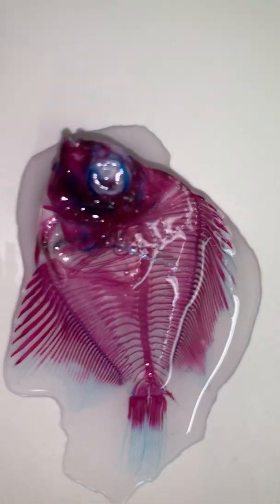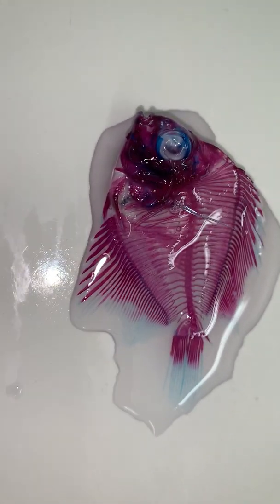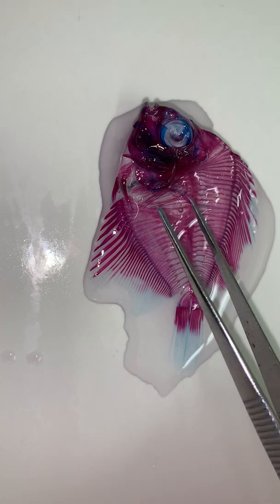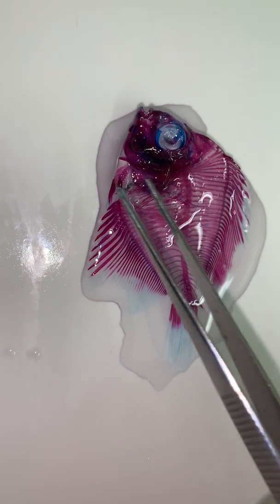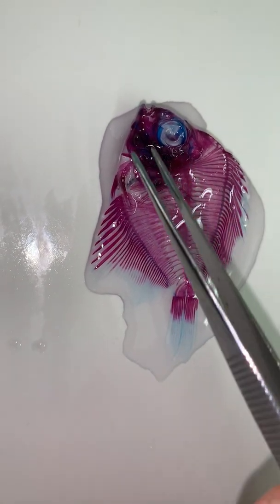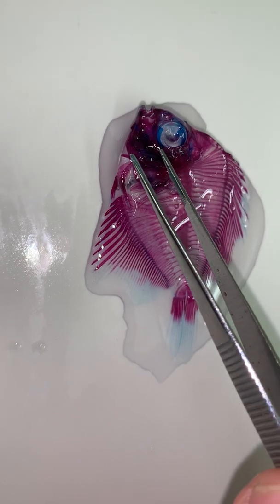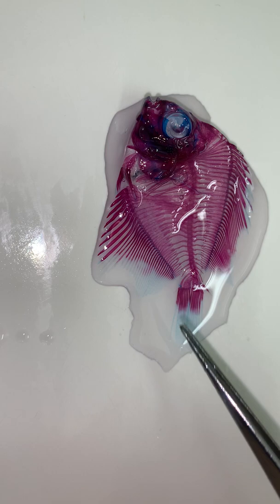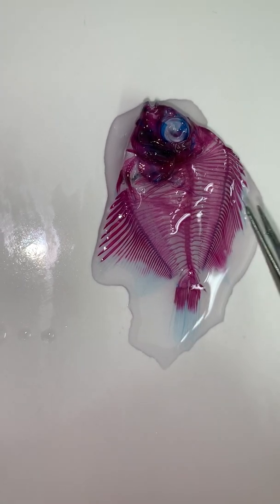If we look over here, the nicer, better cleared specimen. This is a discus fish. It used to be one of my pets. It died. It had a mutant mouth, so I wanted to see what the mouth looked like. And so we can really see the cartilage here, especially the scleral ossicles. Those are these little bones in the eyeball here that are blue. And then we also see some blue out in the fins.